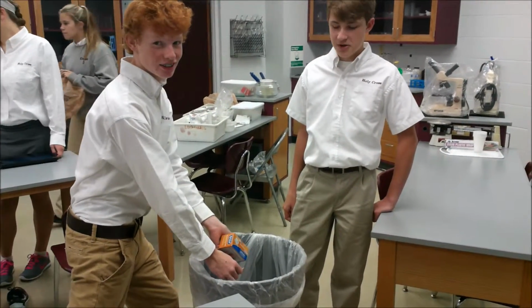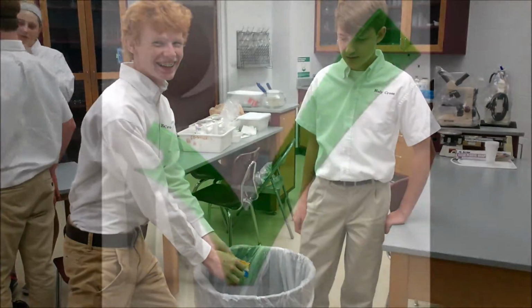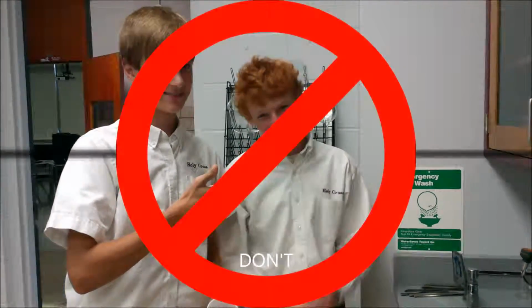Silly Johnny, you can't dispose of gasoline and alcohol and matches in a garbage can. How you properly dispose of liquid waste. Thanks, Bobby. You taught me a life lesson. Thank you.